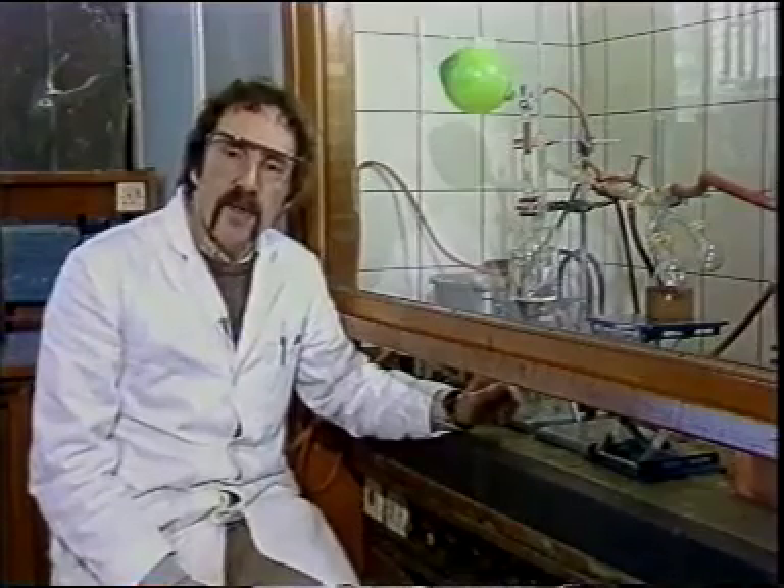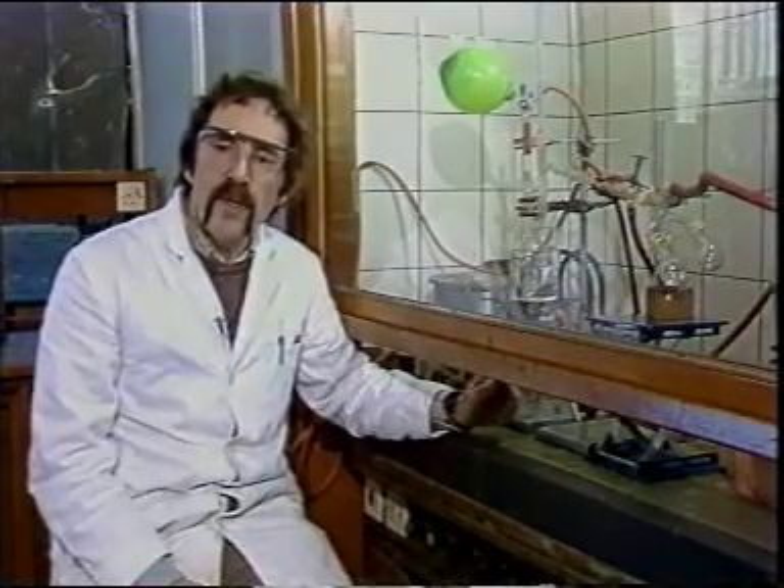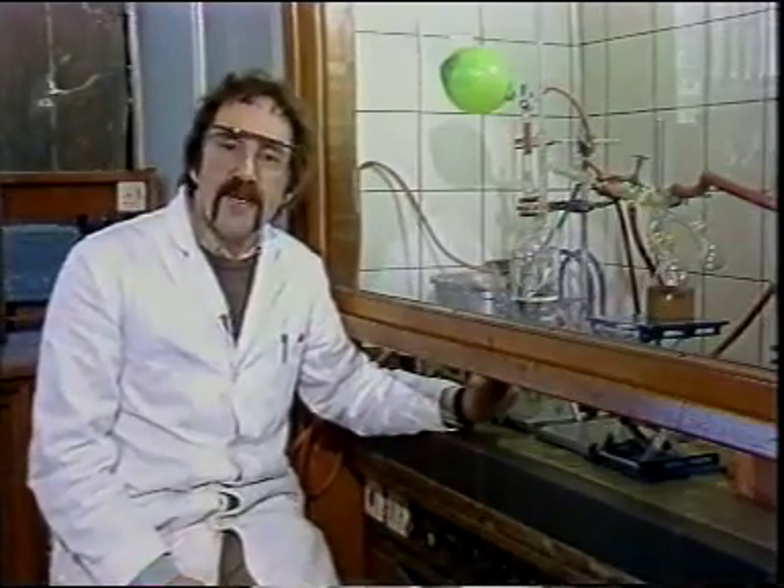When we finish a vacuum distillation, we continue to draw nitrogen through any liquid that's left as it cools down, to prevent it oxidizing when open to the air. Now this equipment may look rather complicated, but it really is very straightforward in use, as many of you will find when you come to do it at summer school.